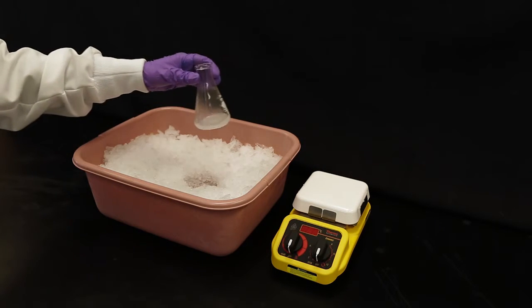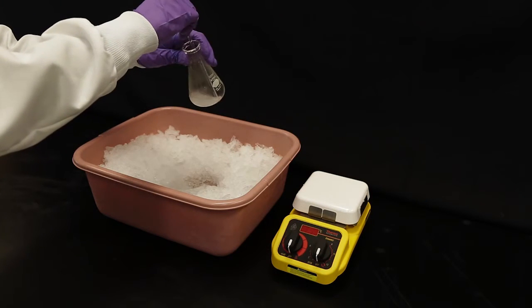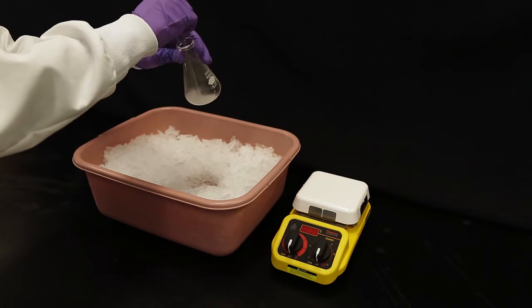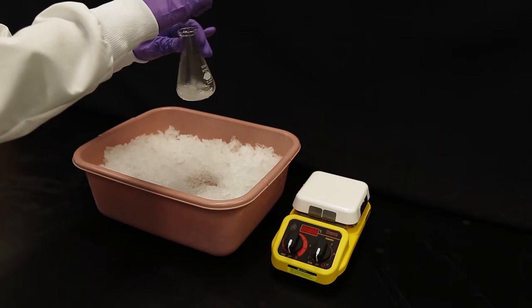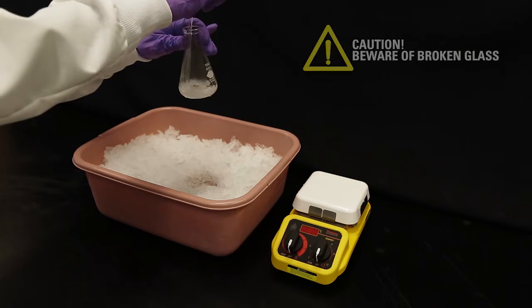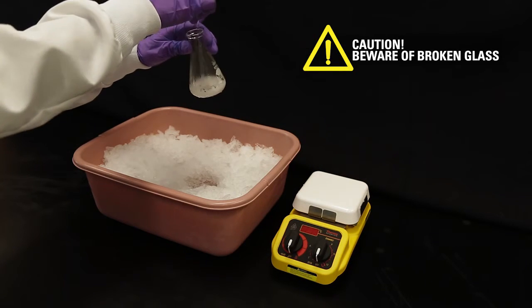There are 2 methods for seeding: adding a pure crystal of the desired compound with a spatula, or scratching the bottom of the glass vessel with a glass stir rod. Be gentle when scraping. Glass rods are fragile and may break and cut your hands.